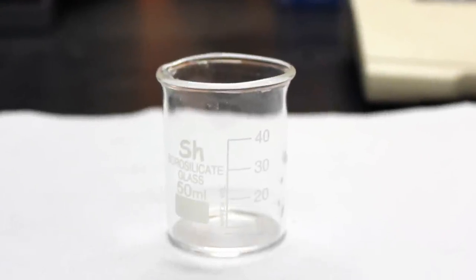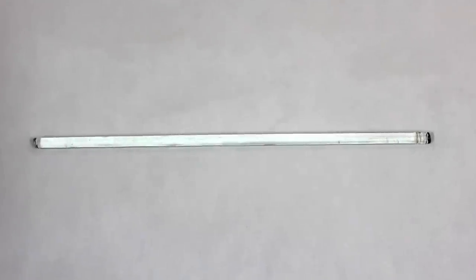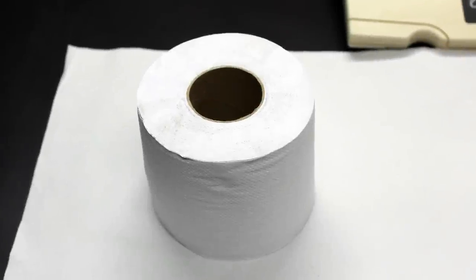50 ml beaker, measuring jar, stir rod, distilled water, tissue paper.